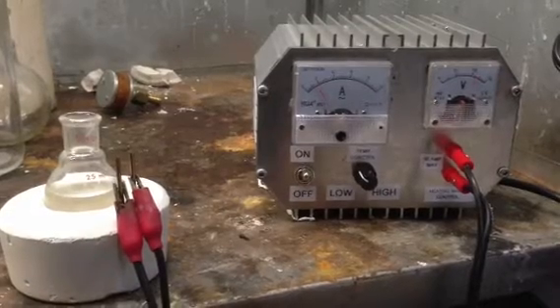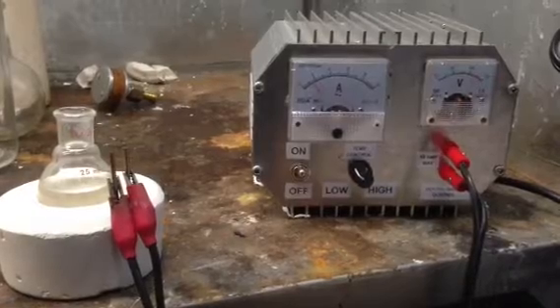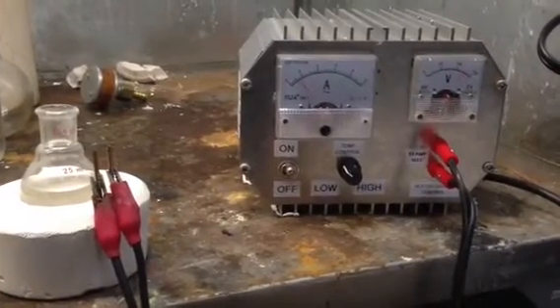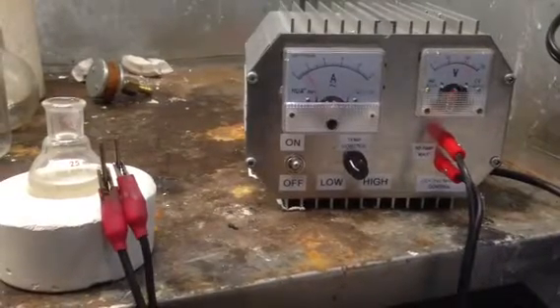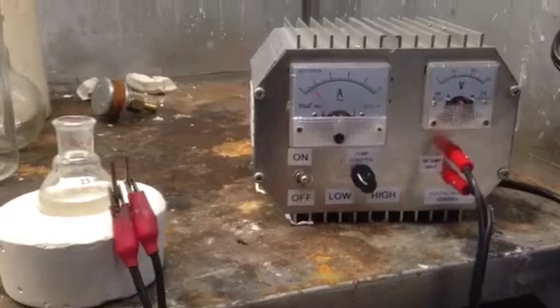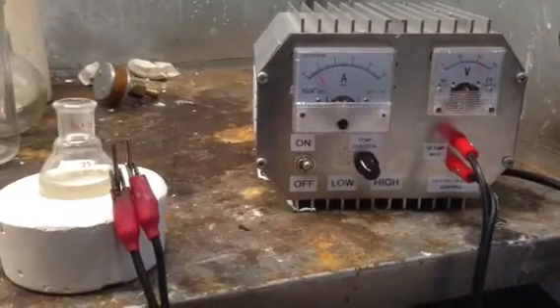Hello YouTube, just going to make a quick video here showing the new TRIAC based variable heating mantle control for laboratory use or any other resistive load will work on this.